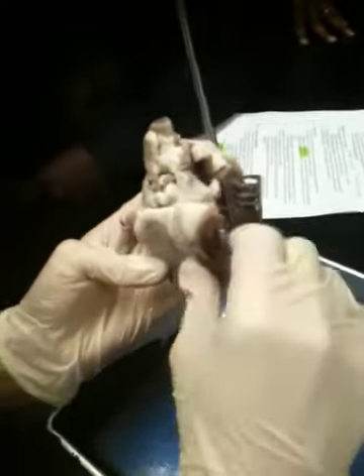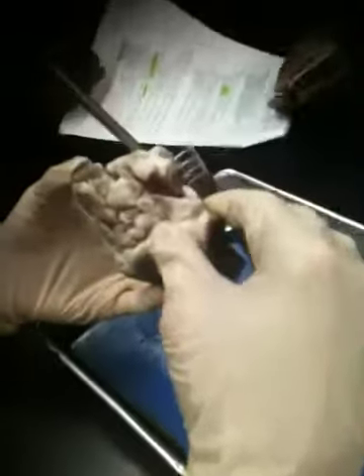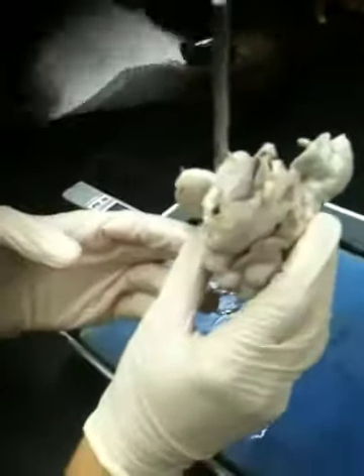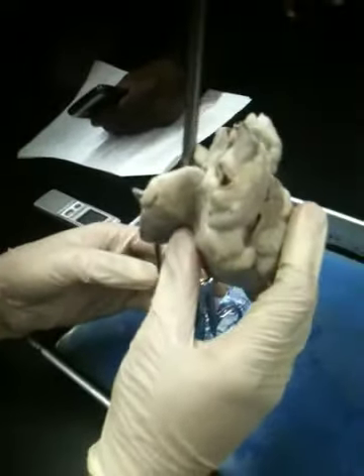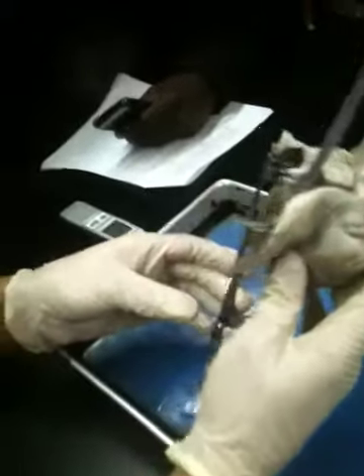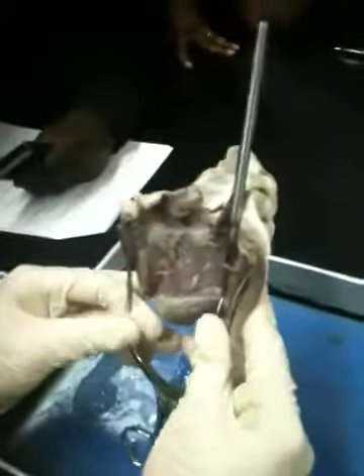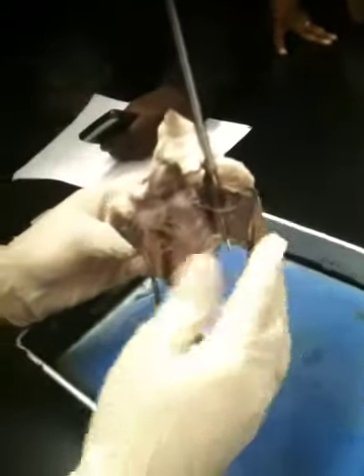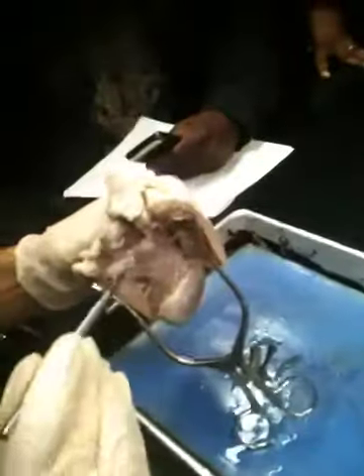Ventricle. Ventricle, sorry. That actually brings up what I was going to mention next, which is how to determine what chamber we're looking at. And actually right now you're looking at two chambers. Remember, I told you I was cutting from the auricle all the way down to the apex, which means when I opened up this entire flap of heart wall, we were actually opening up two chambers. The question is, how do you know where the atrium ends and where the ventricle begins? At those fibers? Where those fibers are?